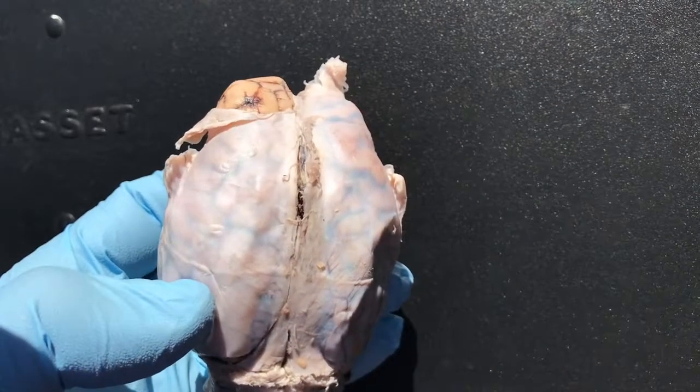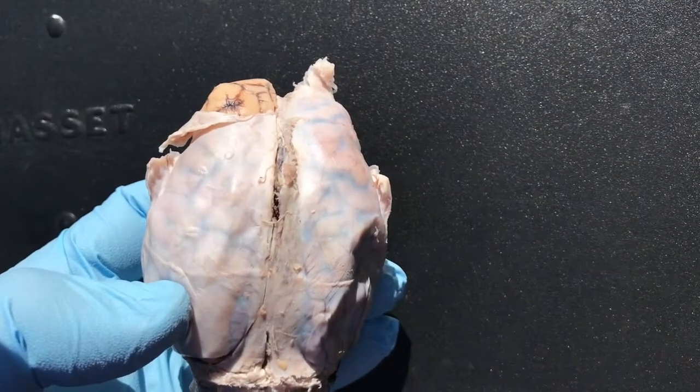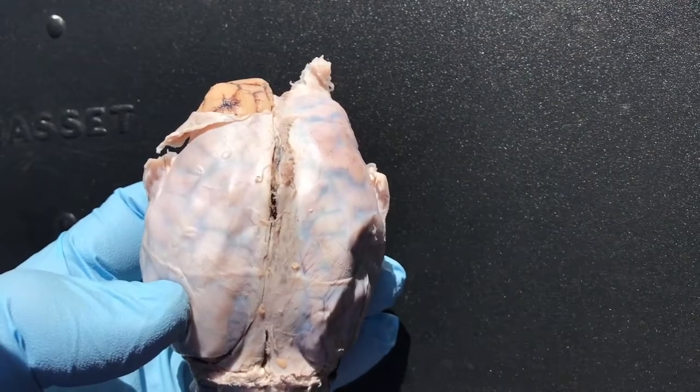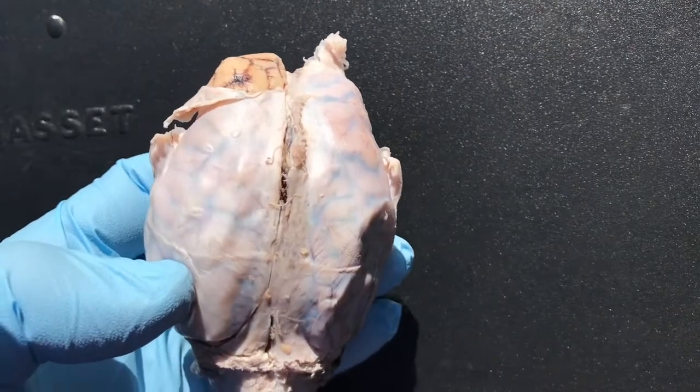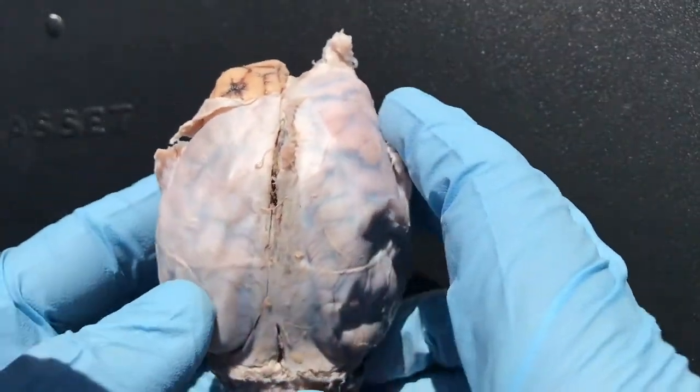Hey everybody, this is a dissection video for human anatomy and physiology, and what I'm holding here is a sheep brain.